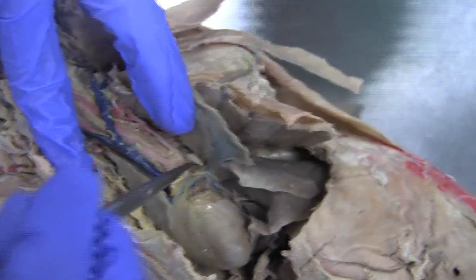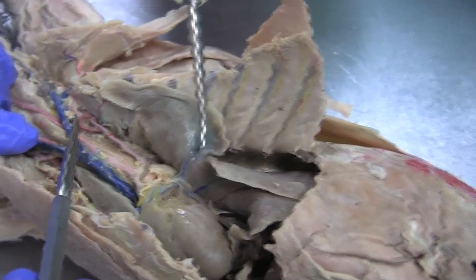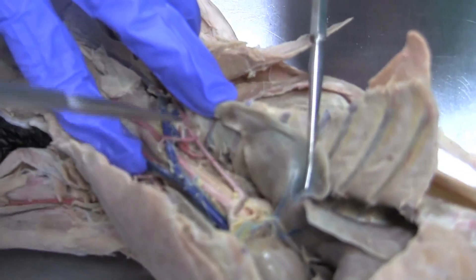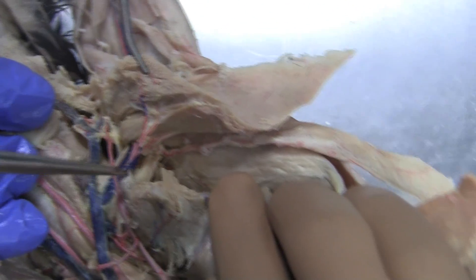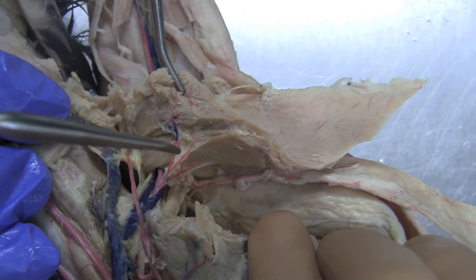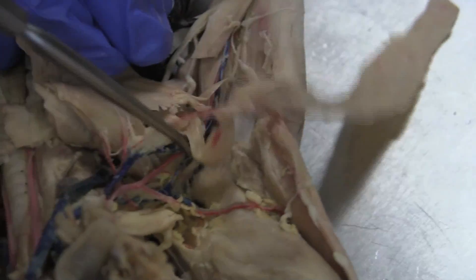Then on the left side of the cat, off of the aortic arch, you have the left subclavian. The first one you meet is the vertebral, right here. Then the costocervical. Going up into the axillary. The thyrocervical artery goes up, and your axillary artery going up. Then the ventral thoracic artery and the long thoracic — but ours branch off of the same. And then the subscapular is branching down towards the scapula, and then that is the brachial artery going out.